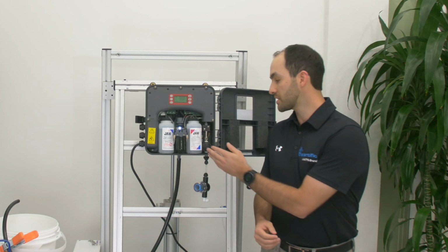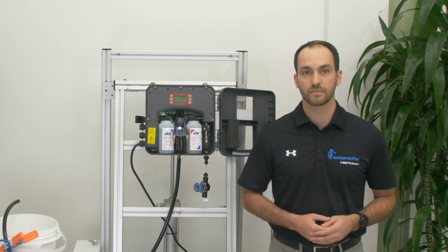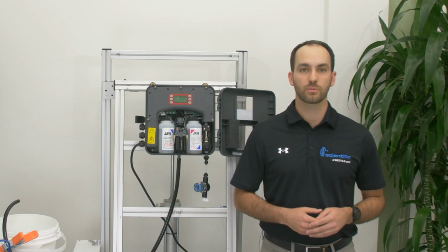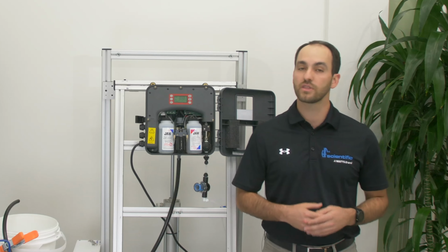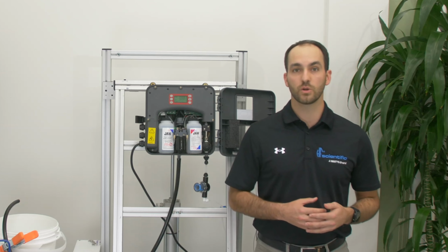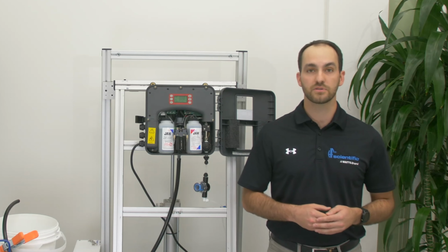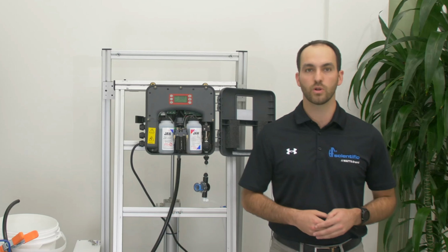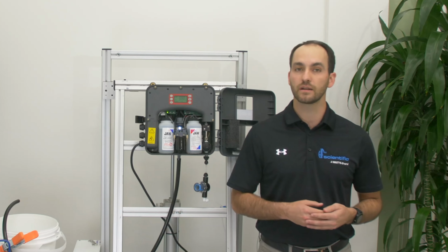The water pressure is controlled by the intake regulator. The regulator protects the intake solenoid by ensuring the water pressure is in the correct range for the intake solenoid to operate properly. The intake solenoid fires, which allows the sample cell to fill and mix. After the reaction, the drain solenoid will open, which allows the sample to drain.